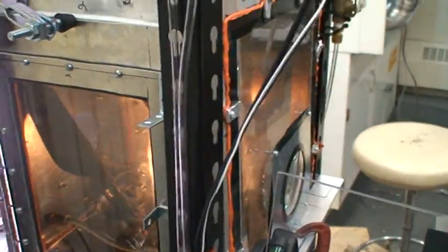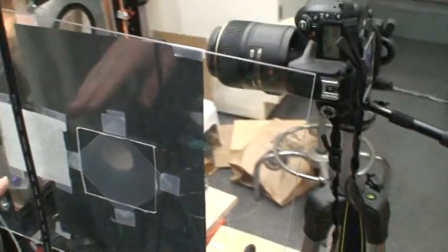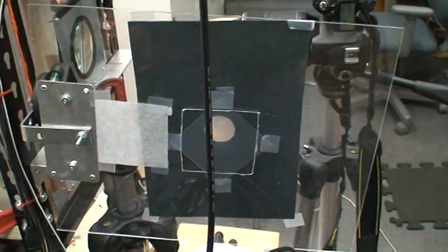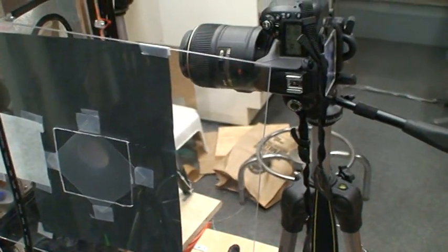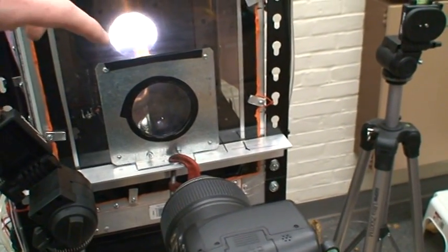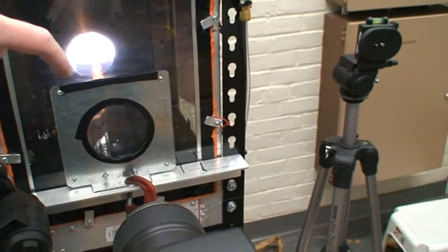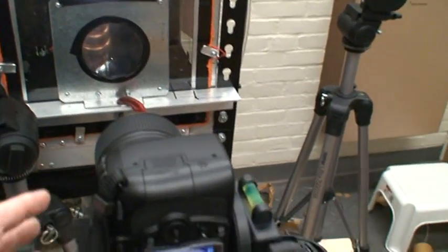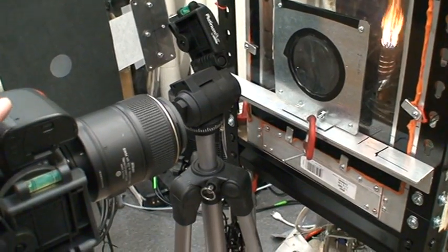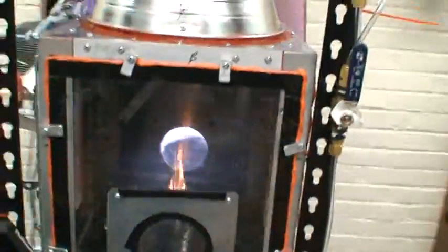We only have three main components. Point source of light, lenses, and then something to capture it on. We did use these screens, either tracing paper or a gray extruded plastic. You can see the Shadowgraph on these screens, but it's much more difficult to capture it and your intensity is much lower. If you don't use this second biconvex lens, then your image is the size of the parallel column of light, so the intensity is much less, it's much harder to capture, and you can only capture part of it inside of the camera because this camera only has a 28mm, I believe it's 28mm by something millimeter lens, so you can't capture the whole area. So when you have a tall flame, you can't get it all on the camera image.